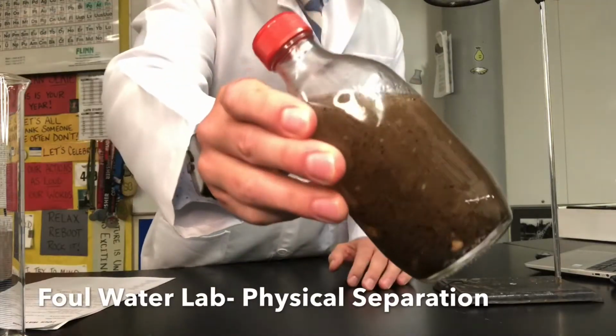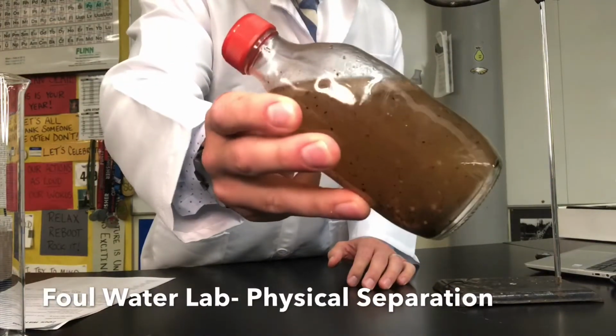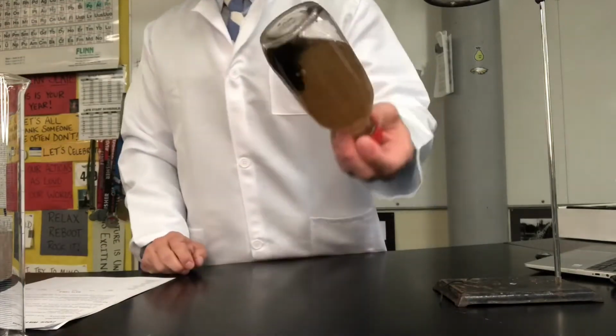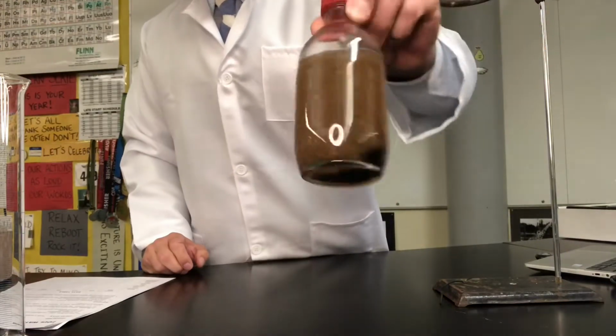If you take a look, this is some really dirty water. So this is going to be a mixture, but this is definitely a heterogeneous mixture. There's a bunch of different chunks in here, different colors. It's not a very nice mixture. So this is some dirty water.